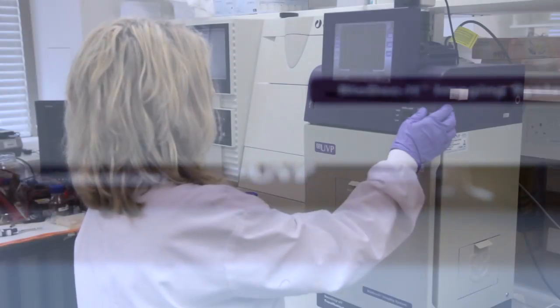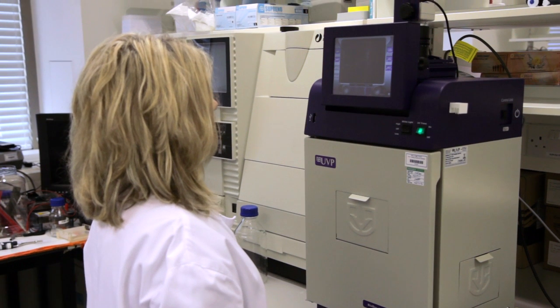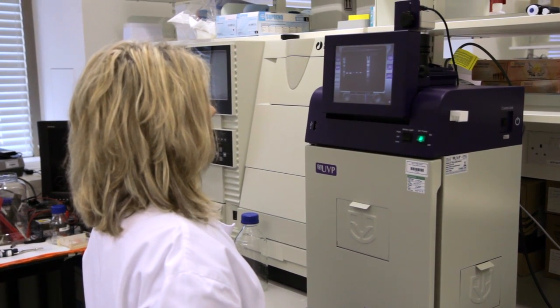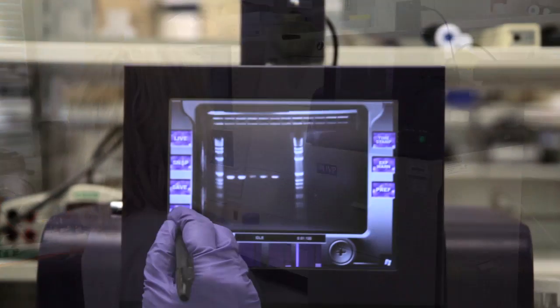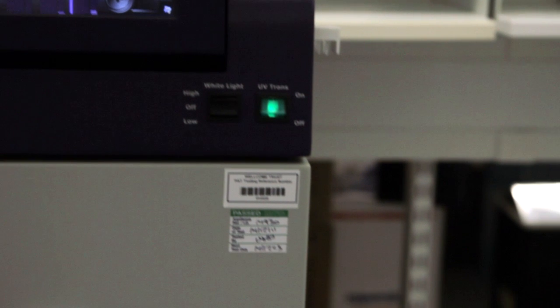Also be aware that DNA will diffuse within the gel over time. An examination or photography should take place shortly after you stop the electrophoresis. Once photographed, the bands on your gel can now be analyzed and compared with your known size standard.